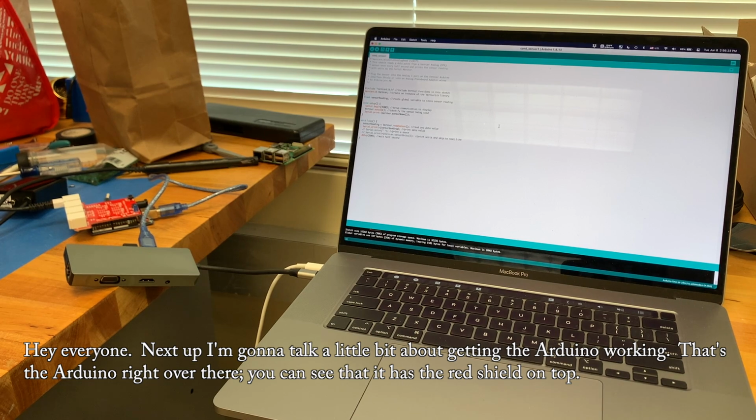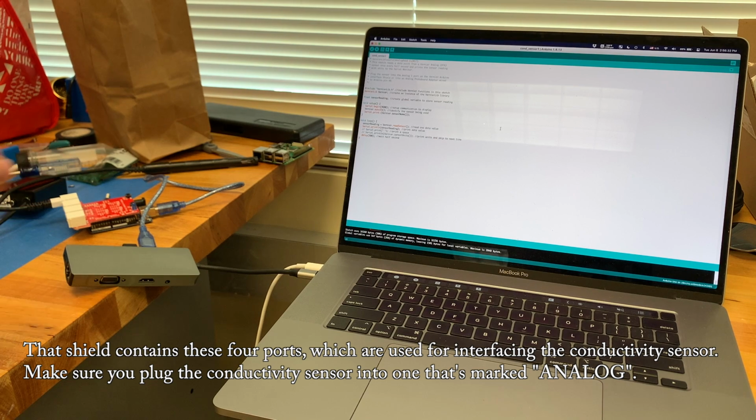Hey everyone, next up I'm going to talk a little bit about getting the Arduino working. That's the Arduino right over there. You can see that it has the red shield on top. That shield contains these 4 ports which are used for interfacing the conductivity sensor.